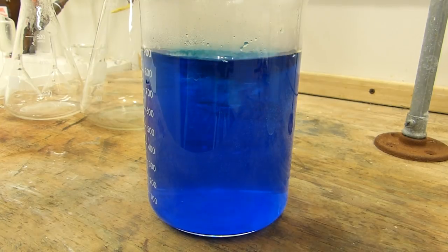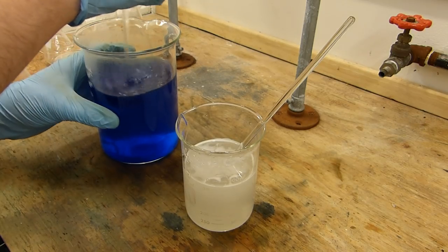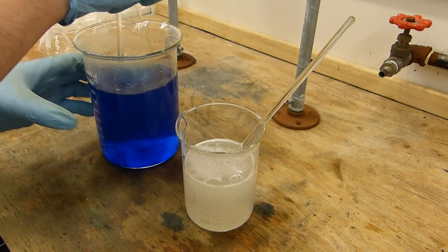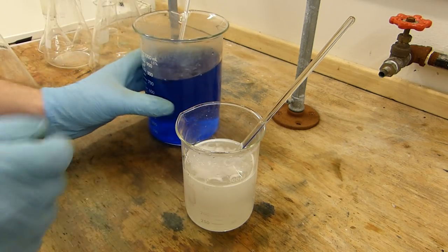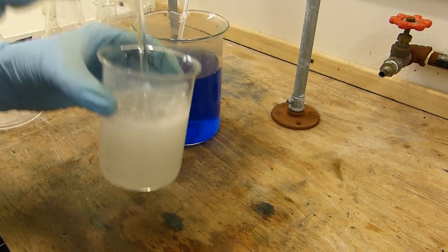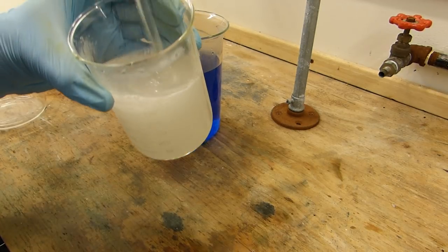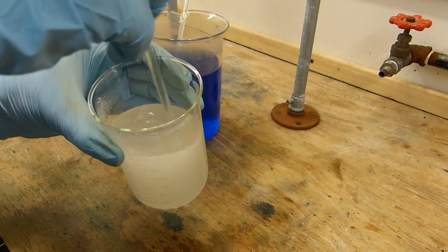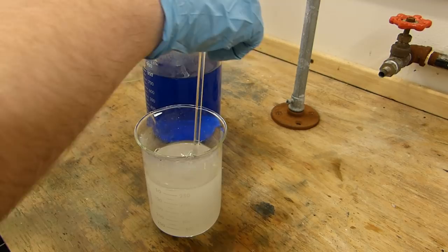Nearly there. I now have just about all the copper sulfate dissolved forming this nice dark blue solution. However, my sodium carbonate isn't looking so good. You can see there aren't many solids left, but there is this milky suspension that's formed. That's typical for this type of sodium carbonate.